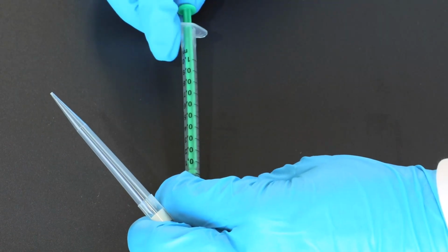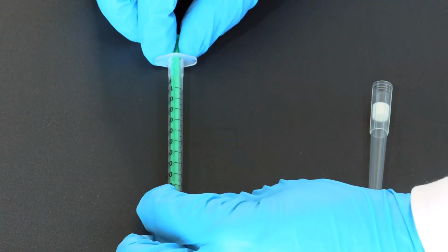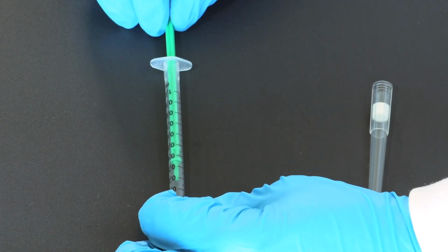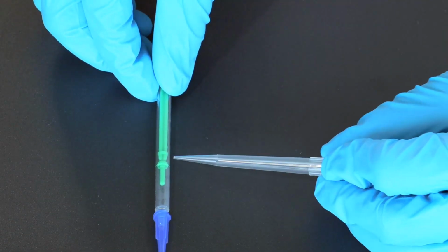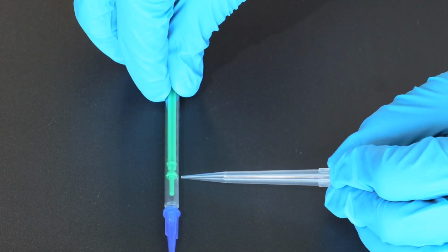To be able to correctly measure out a certain amount of liquid using the syringe, we will need to press down the plunger all the way to the very bottom, and then as we're aspirating the liquid, we will need to focus on the very widest part of the plunger that almost looks like a mark, the one that surrounds all the walls. If I flip it over, you will see it in a little bit more detail here. So this part of the plunger is the one that's used for measurement.